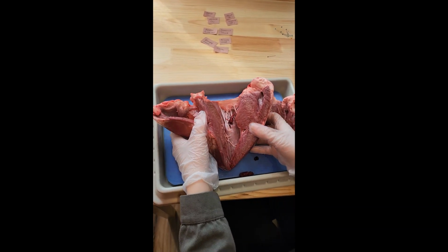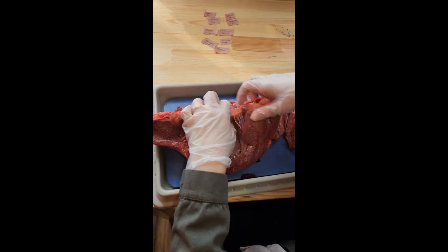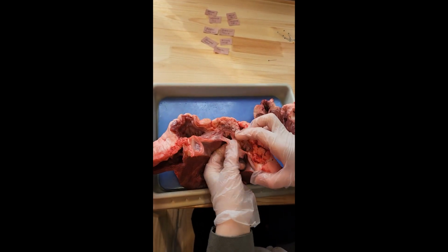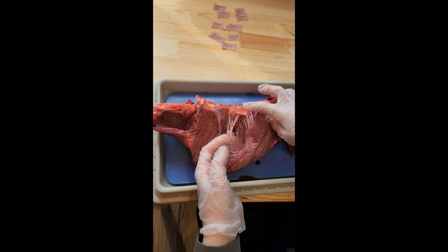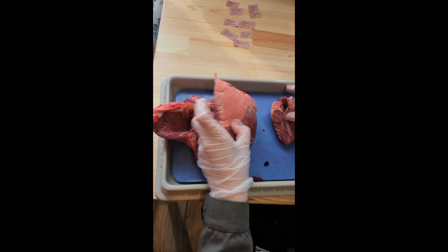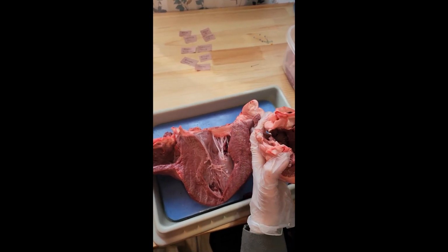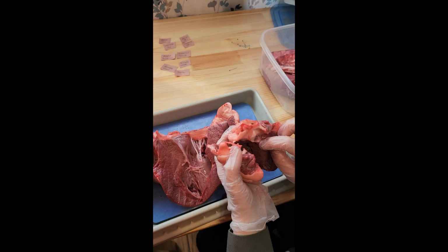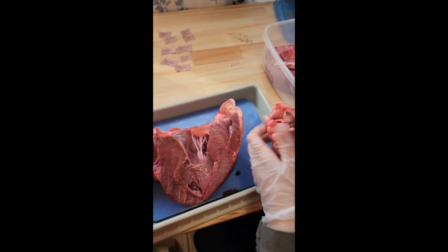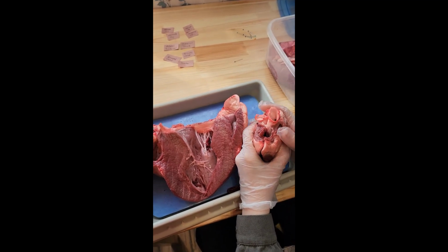and the blood now is oxygenated. So it goes to the left atrium, then to the bicuspid valve. Here we can see the bicuspid valve. This is one, this is two. And then it goes to the left ventricle, and then to the aorta. Here we have the aorta, it's clear here. And inside the aorta there is a semilunar valve over here. And then the blood will exit the heart as oxygenated blood through the aorta to the body again.